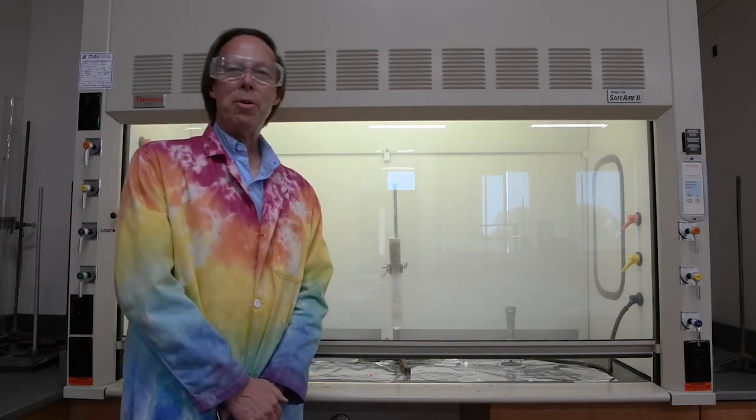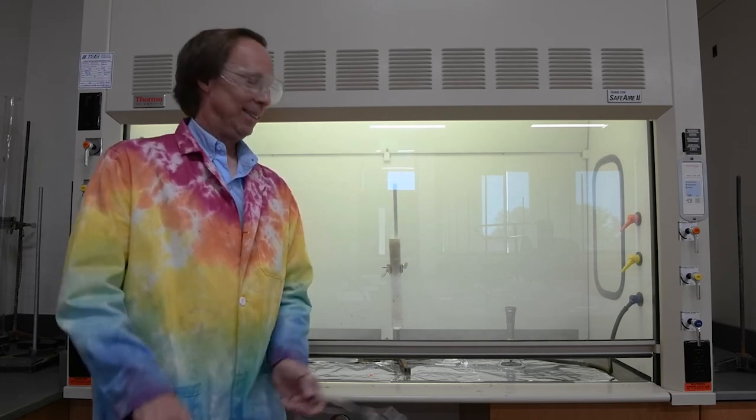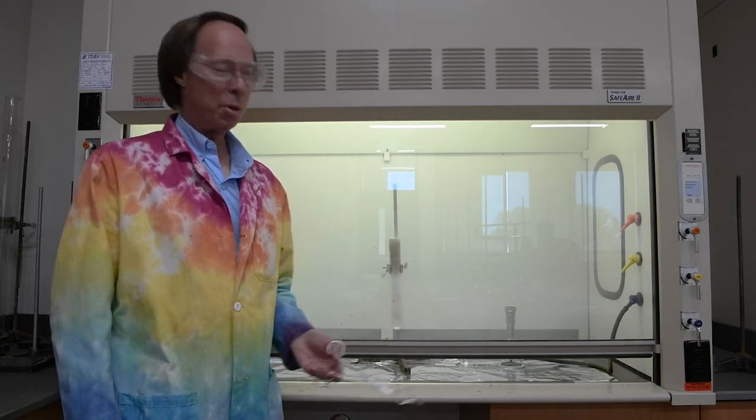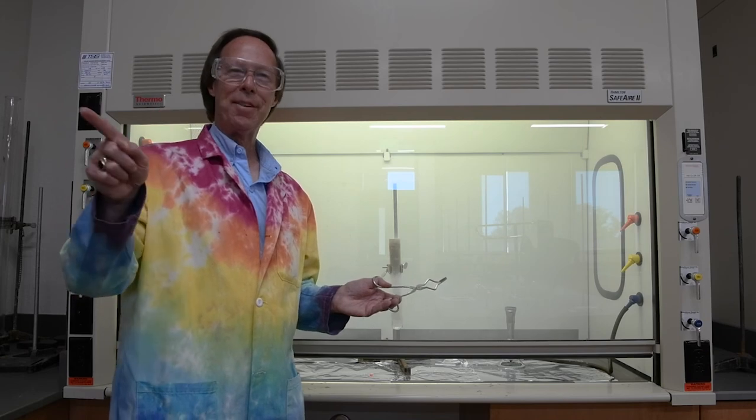So the next time you eat a candy bar, the label says 250 calories, and you remember these things that have 2 or 3 calories, just imagine what would happen if we dropped a Snickers bar in that test tube. I think I would want to be running the other direction.